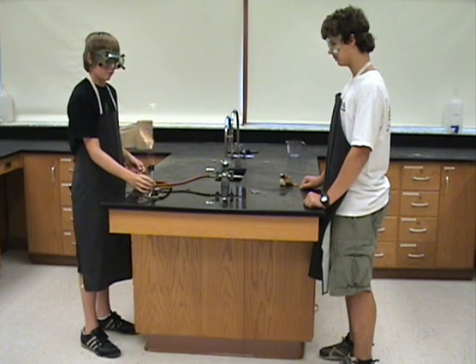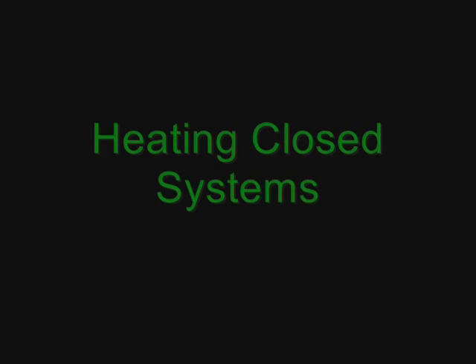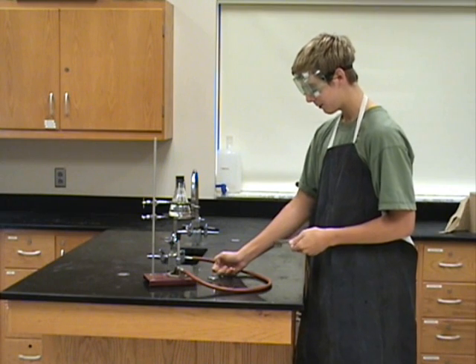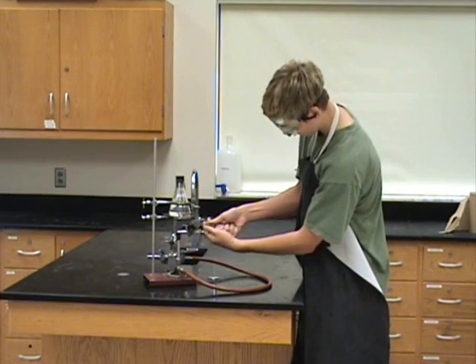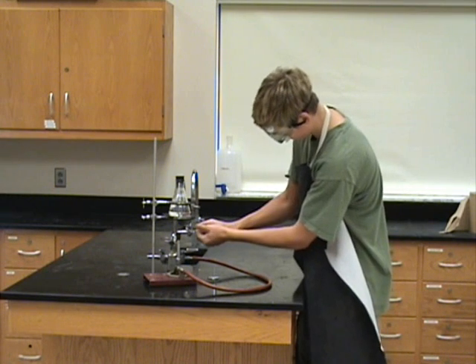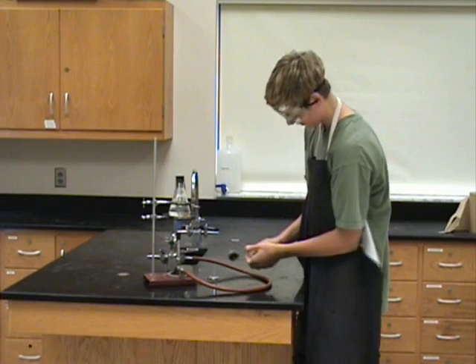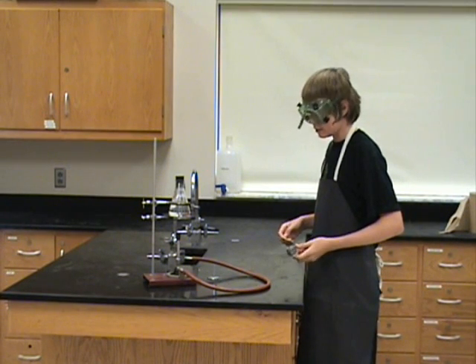These students have now followed all the safety rules and are alive and safe, at least until they break more rules. Observe as this student's failure to adhere to the rules cost him his life. I am about to heat this closed flask, which is a closed system, on this burner. The following student will adhere to the rules and will not heat a closed system.